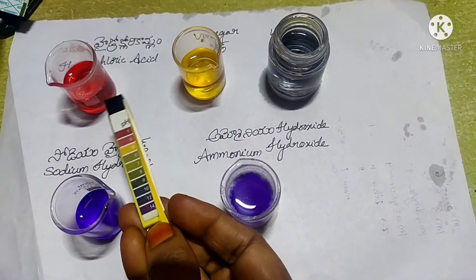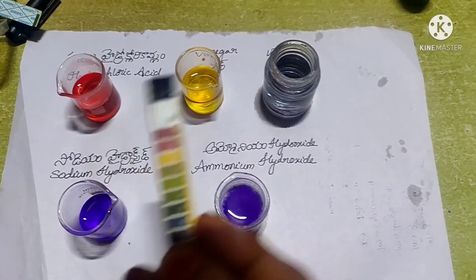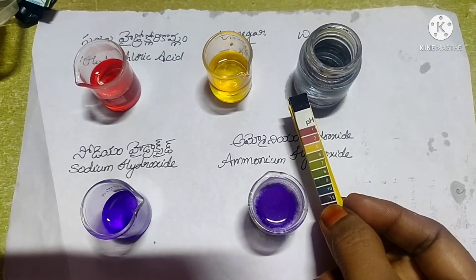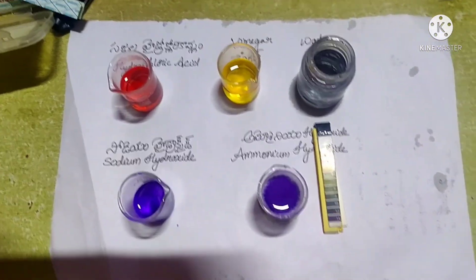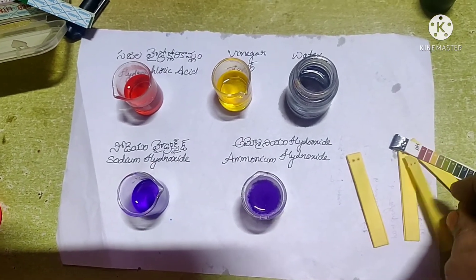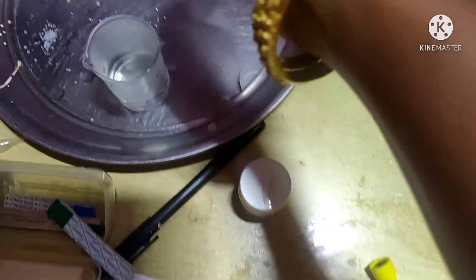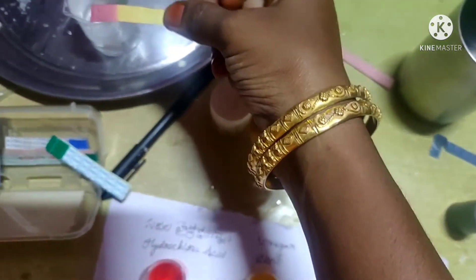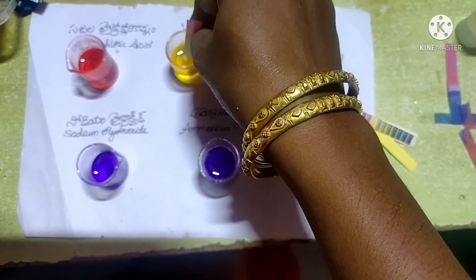The red color indicates pH 1, which represents a strong acid. The yellow color on the pH scale indicates pH 3, and pH 3 indicates a weak acid in vinegar solution. The pH value of water is 7, so it is a neutral solution.